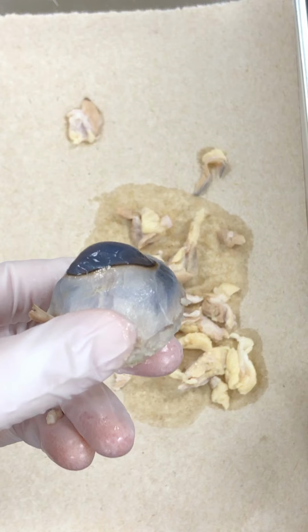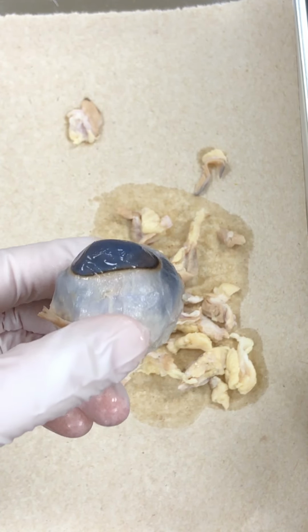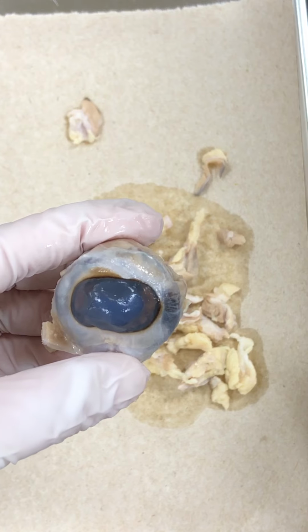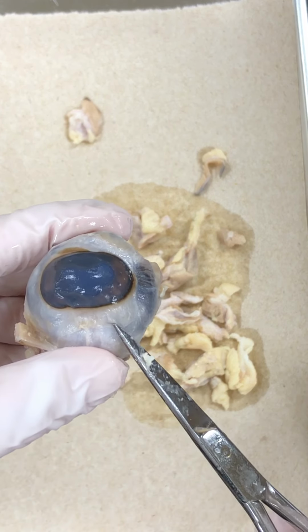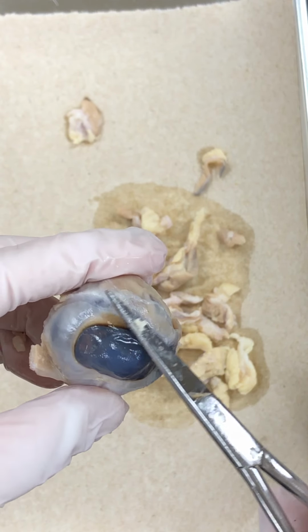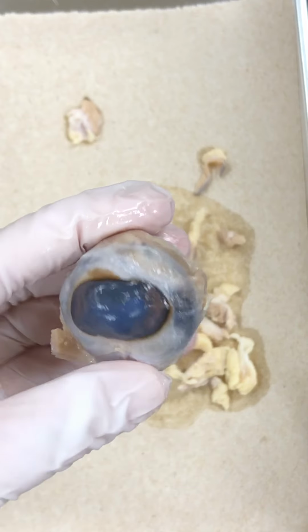It's also very curved, right? And that's going to be a part of the key to getting the light refracted onto the lens and then refracted again onto the back of the retina. Okay, this again is the sclera, the white part of the eye that we see when we look at each other, and that follows all the way to the posterior side.